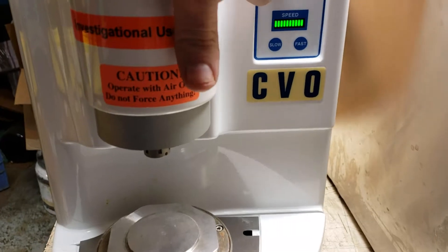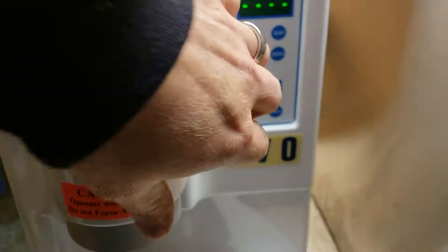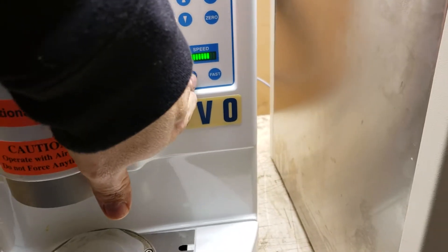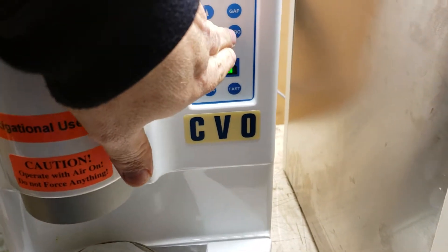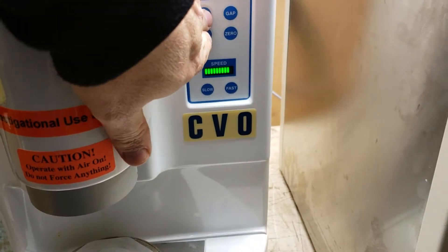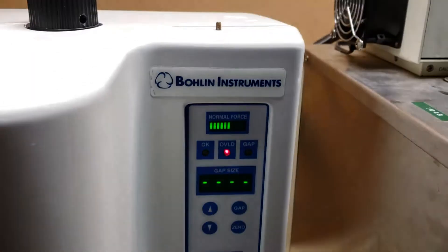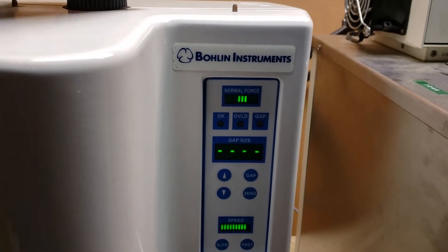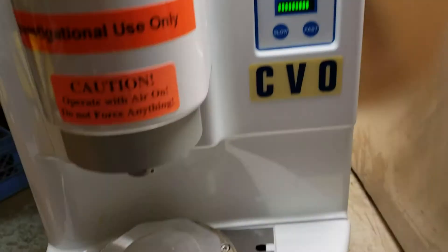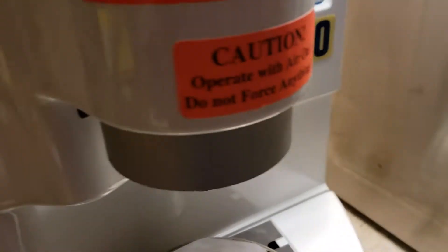I don't really know what I'm doing here, but I got this piece turning — this knob on the top, I got that turning. I can't remember how I did it though. I think I zeroed this. It says it could be overload.